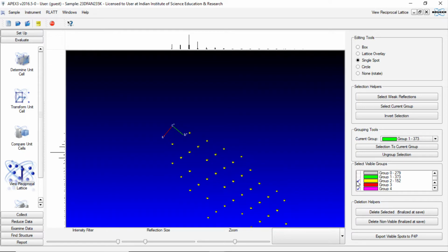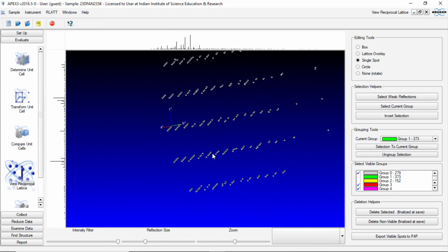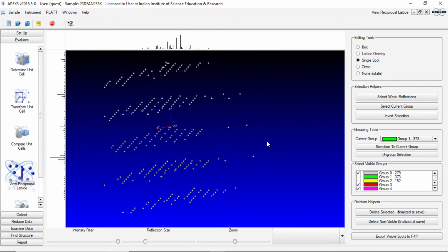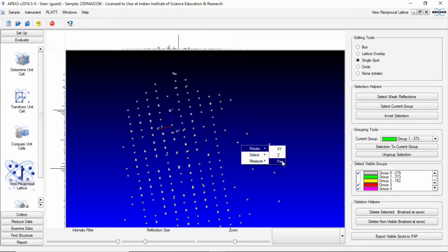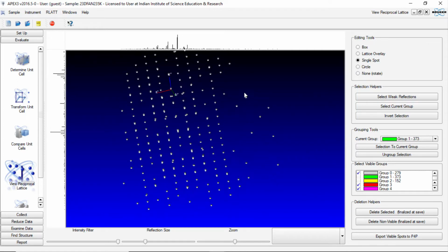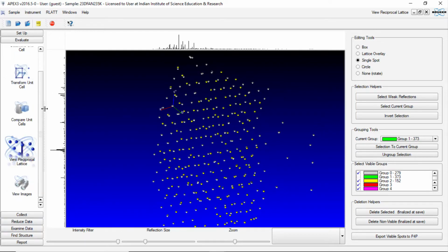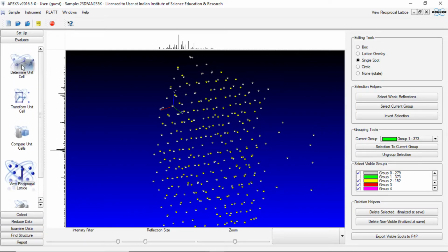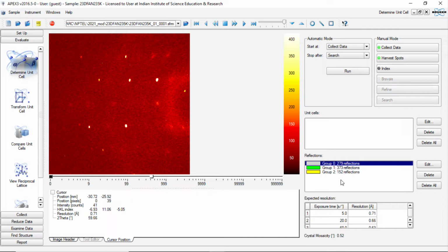So we need to check this for both the gray and the yellow, and we'll rotate the reciprocal lattice in all possible directions to see if there are any reflections which are not aligned with the other reflections. Right? So now we have two sets of reflections, yellow and gray. Now we go back and try to determine the unit cell. You see that 804 reflections are now split into gray, green and yellow.